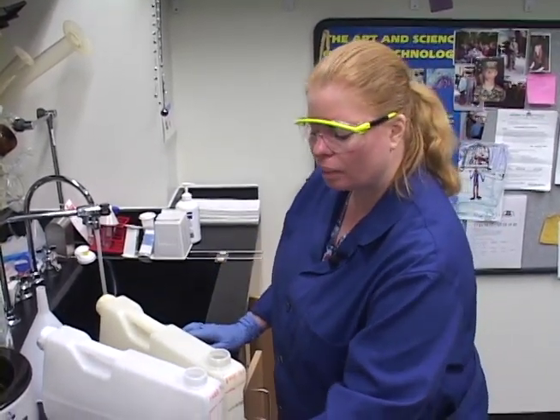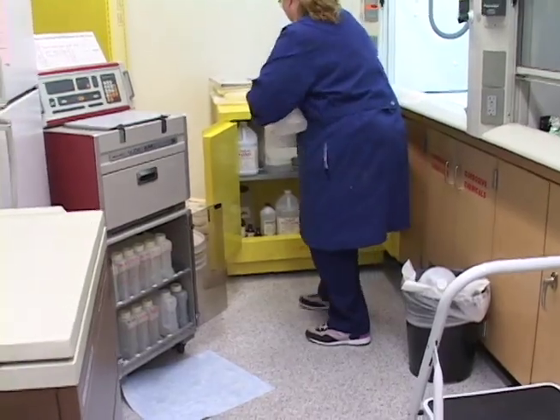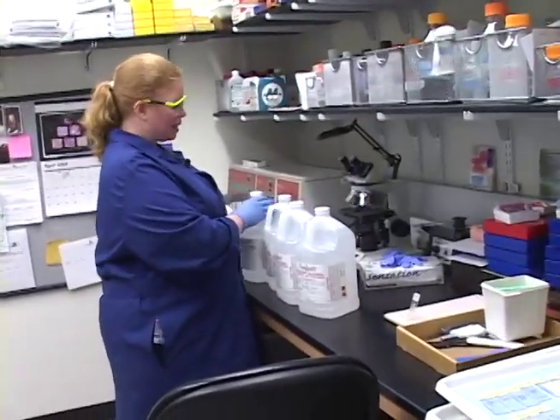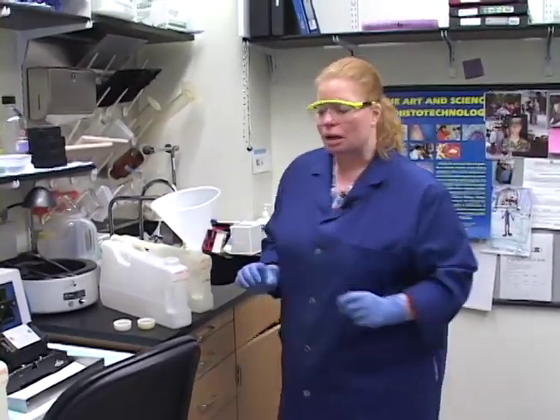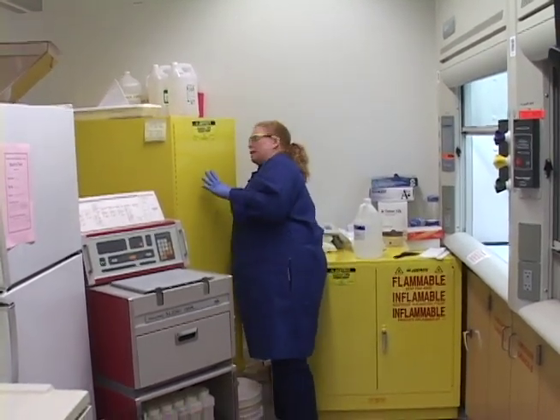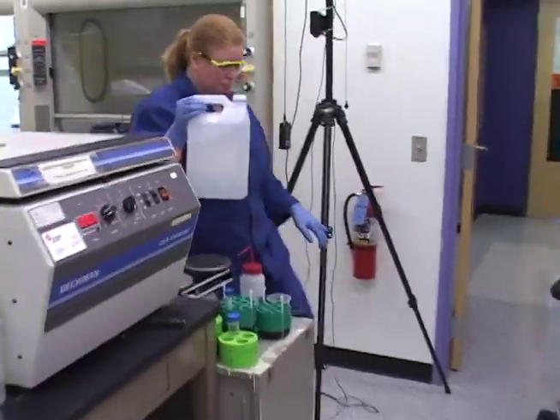I showed you in the fire cabinet where the 100% alcohol was. I'm going to go get those and bring some back to fill these up. I also do this in this order so I know for sure nothing is mixed up with the xylenes or 100%. I'm going to grab the bulk alcohol I keep in the big fire cabinet. That bulk alcohol can be in refilled plastic jugs or big brown jugs — we're looking for 100% ethanol. I just keep refilling jugs with those from the dock. It's a lot cheaper and we certainly don't need to waste our good reagent alcohol for purging.